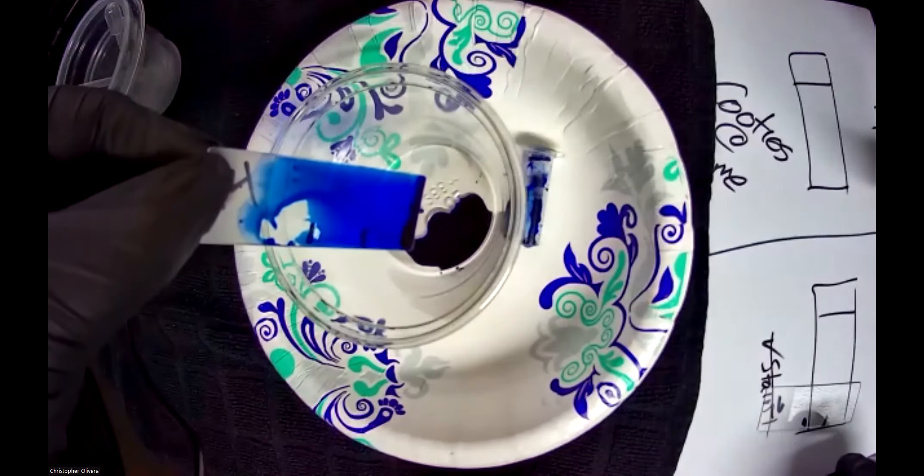Put it on my little marker over there — and that's it. These are the two slides you need to bring to campus to observe. Put them in a safe place and make sure nothing touches the top of them because you'll get the stain rubbed off. To recap: slide 14 — one stain, one minute, done. Slide 16 — three stains and a wash with alcohol, and we're done. Take these two slides and bring them to campus where we'll look at them under the microscope. That is absolutely all we're doing for this lab at home.